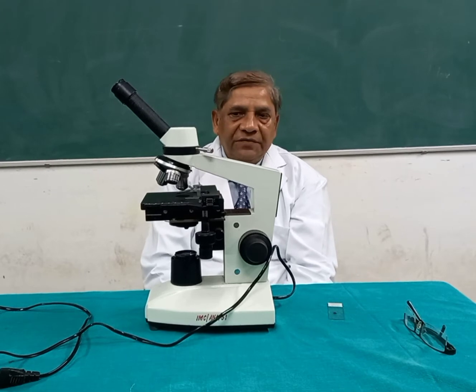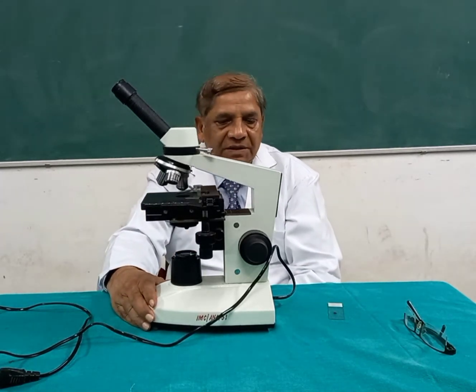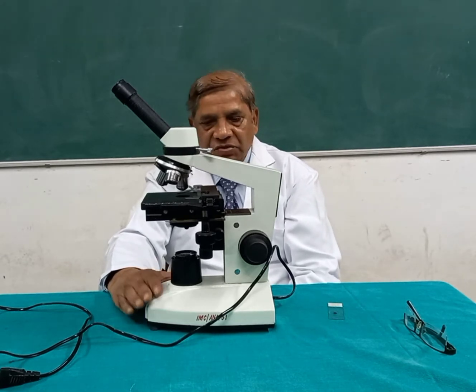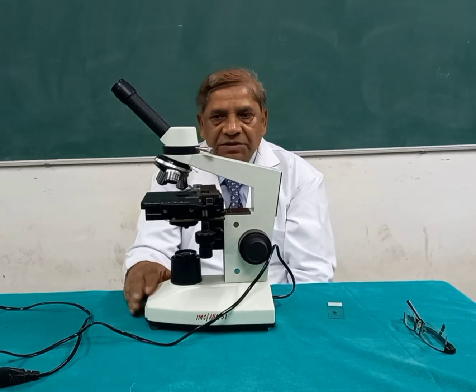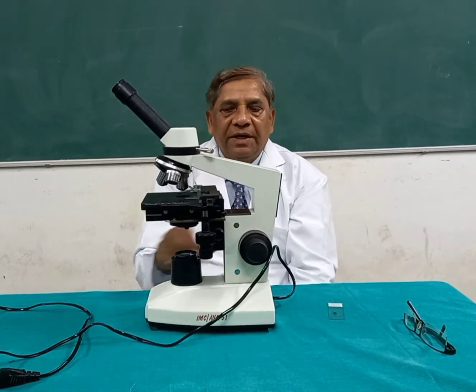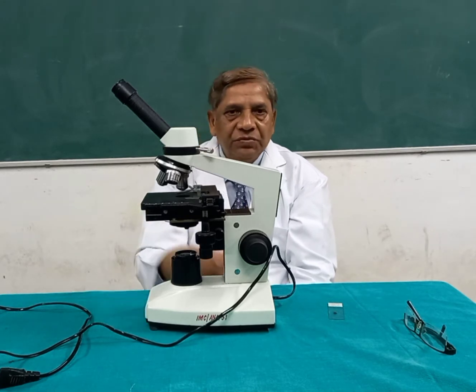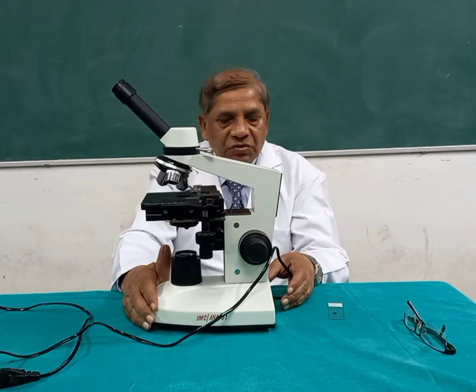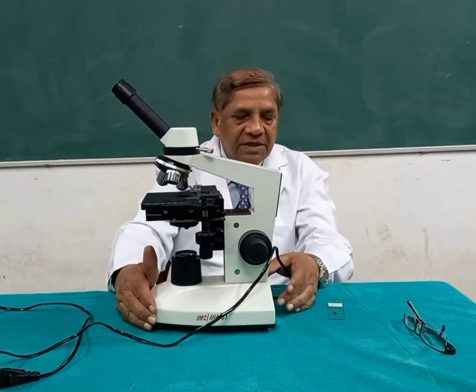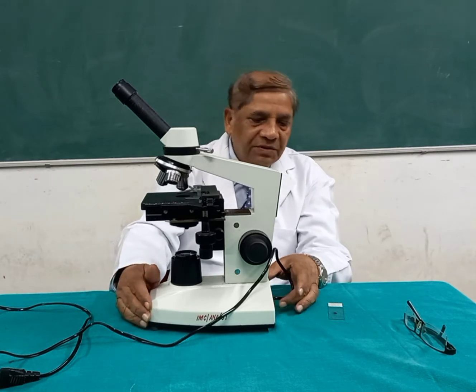Today in this short video I am going to show you the parts of the light microscope. This microscope is useful, and throughout the world for histology classes we use this kind of light microscope to enlarge the image of the tissues. Now, if we go to the parts of the microscope, as we always teach in the first class, the very beginning of the histology classes.